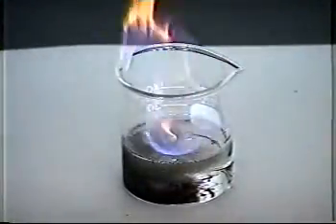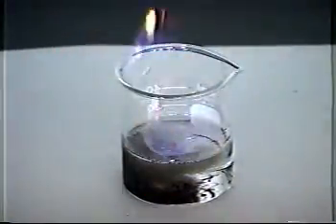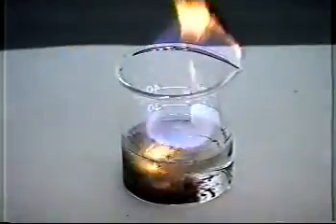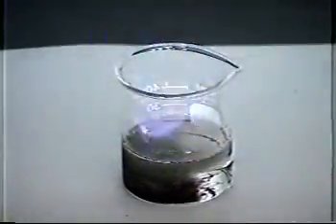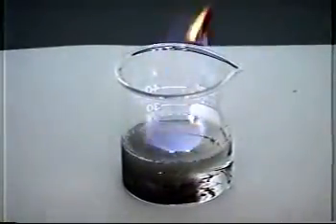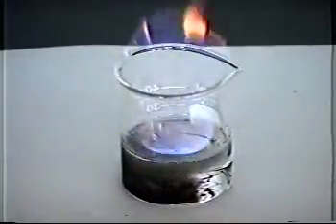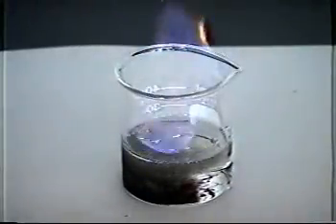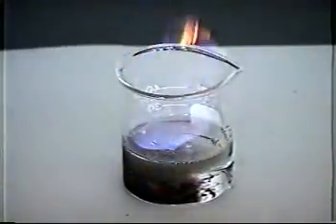The product of that chemical reaction then rises to the top of the beaker and starts a second chemical reaction with the alcohol. That chemical reaction also converts potential energy to kinetic energy, and the evidence for that are the flashes of light, the popping noises, and the heat. The heat becomes so intense that it starts a third chemical reaction, the combustion of alcohol. That chemical reaction also converts potential energy to kinetic energy, and the evidence for that is the flame, which is, of course, both heat and light.